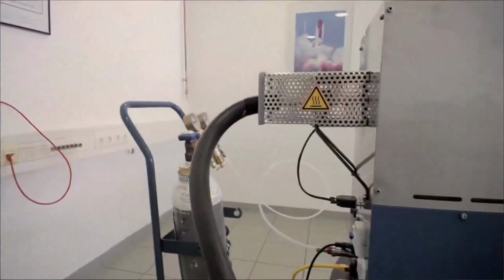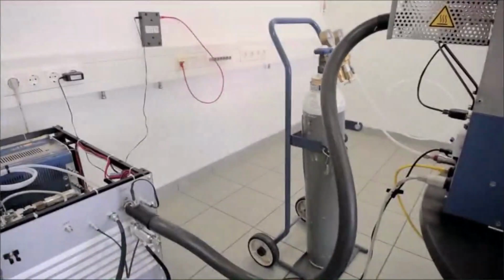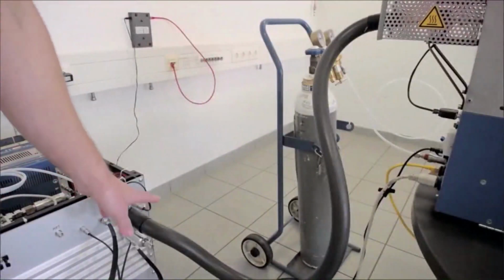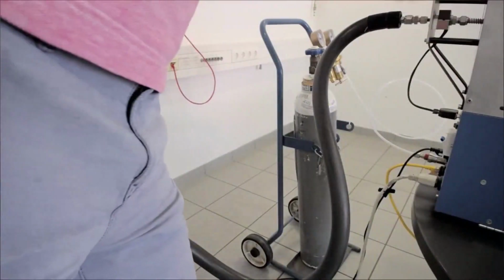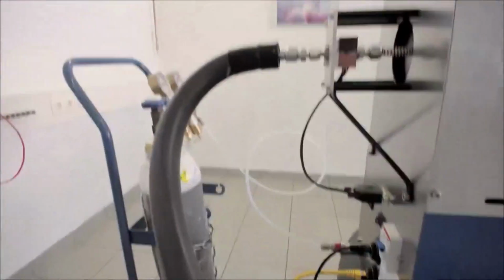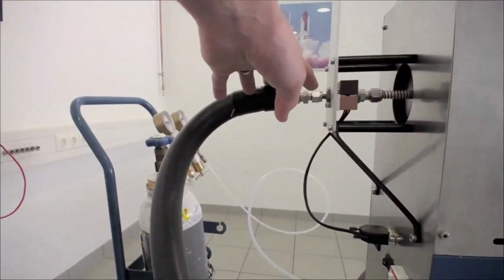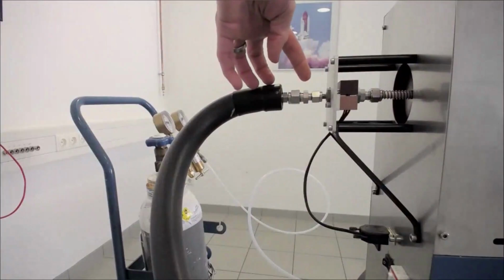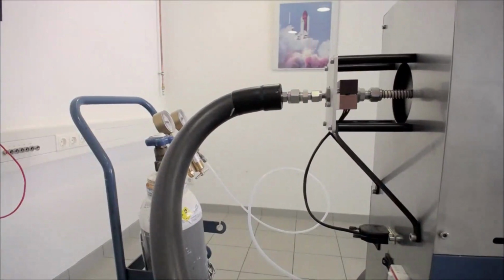On the other side, we have already seen that. So we have to connect, just seeing that I'm getting it all on camera, the transfer line from the gas oxidizer to the instrument. I can remove this grid as well. So you see here, this is a connection that comes pre-made. So it fits here on, again, a 1/4 inch Swagelok connection. And therefore, the whole system is finally set up.